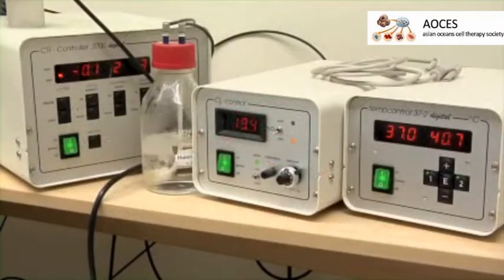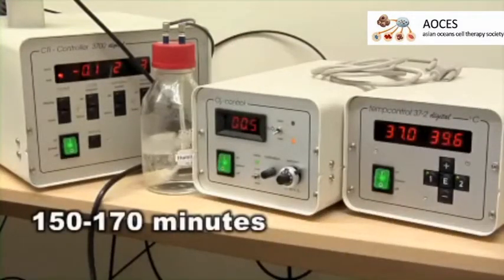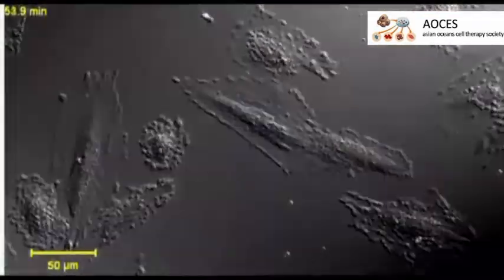Wait until the level of oxygen reaches 0.5%, then start the timer. 0.5% oxygen means approximately 3 mm of mercury partial tension. Subject cells to 150 minutes of simulated ischemia. During ischemia, cells are getting detached from the surface and their membrane starts blebbing.